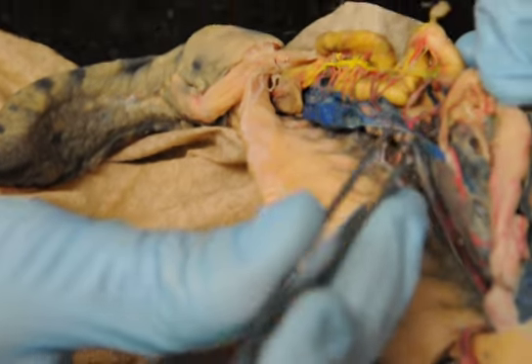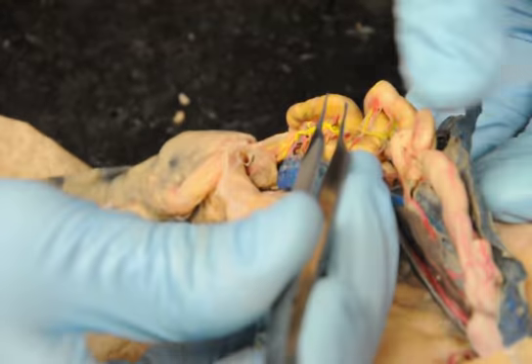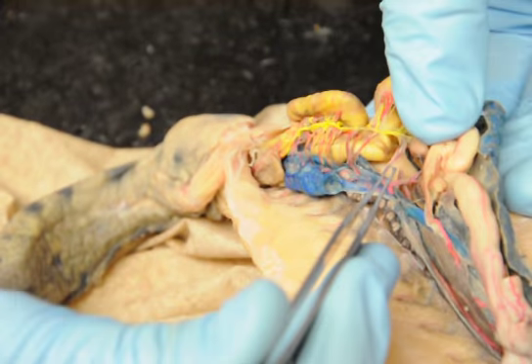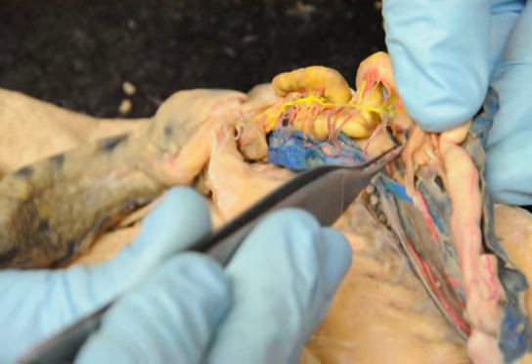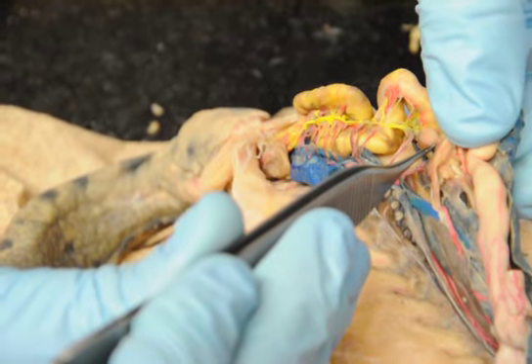So, celiaco-mesenteric, you can see a little V, and this is something you probably just have to get your head closer to see when we're done, but your left branch of the V is going up towards the intestine. Some of yours will actually show that going all the way to the intestine a little better than this one, but this one shows the branch better. So left turn, from at least this direction, pancreatico, what did I just say?